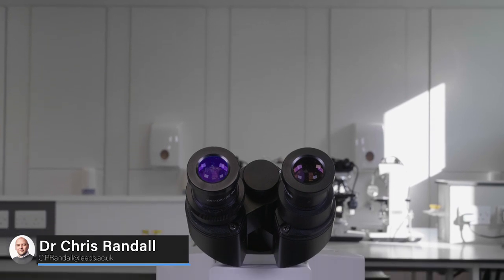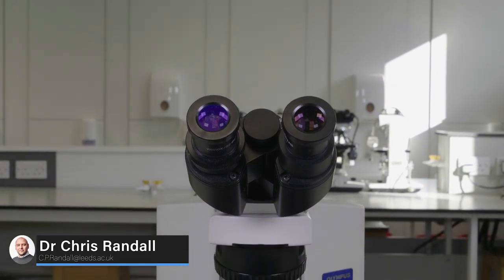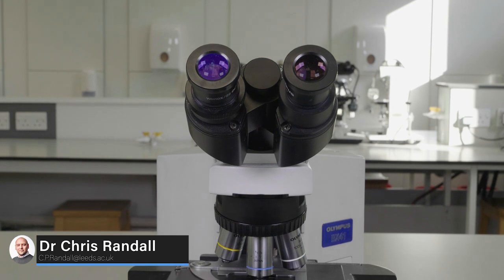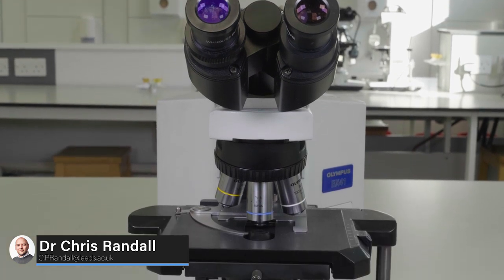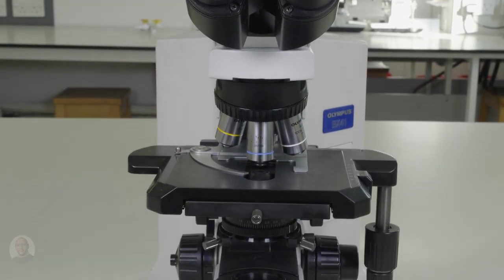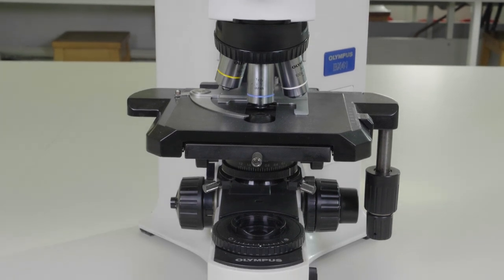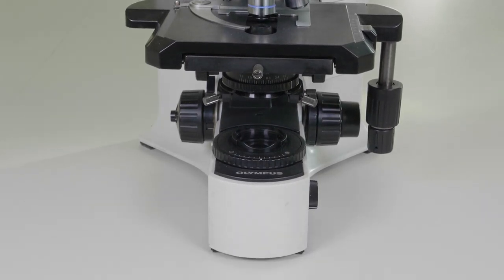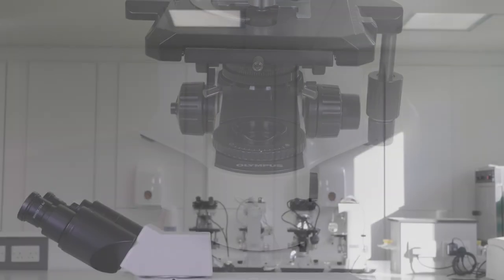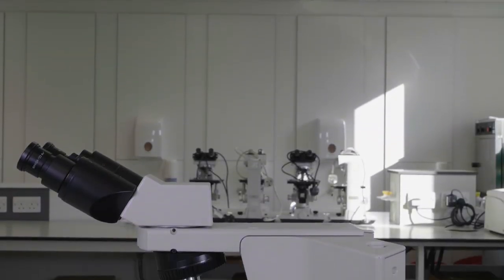In this video we are going to show you how to set up the light microscopes in the microbiology laboratory. This is a very important part of your laboratory practice as you need to ensure that your microscope can achieve its maximum possible resolution so that you can view the microorganisms you'll be working with.